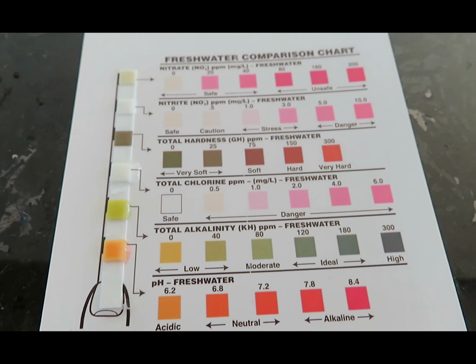My hope is to get some of these water testing strips into the hands of some of you Connecticut Envirothon students. You can test your tap water, a local water body, stormwater runoff, or rainwater, or even a few of these and compare your data. Your data can contribute to a nationwide water database and can help create baseline data to identify problem locations.